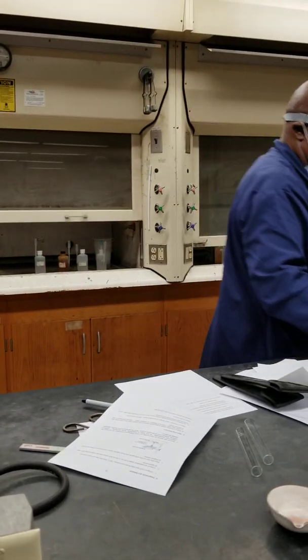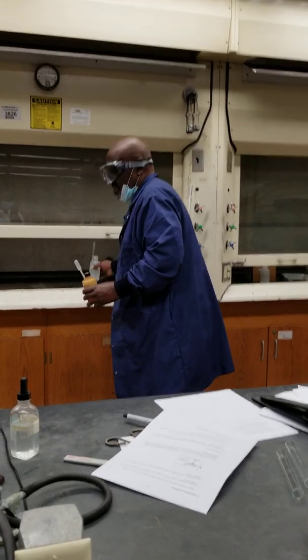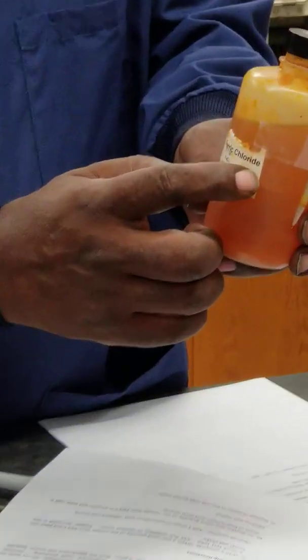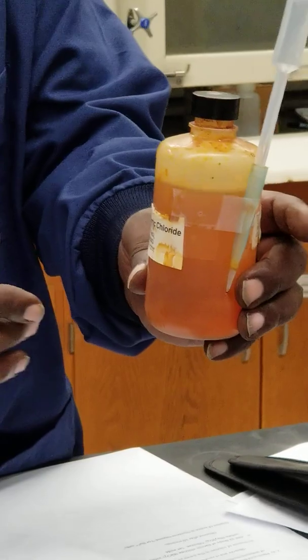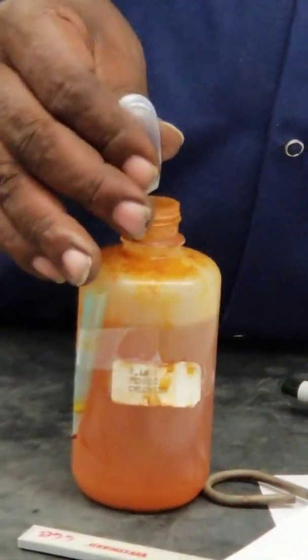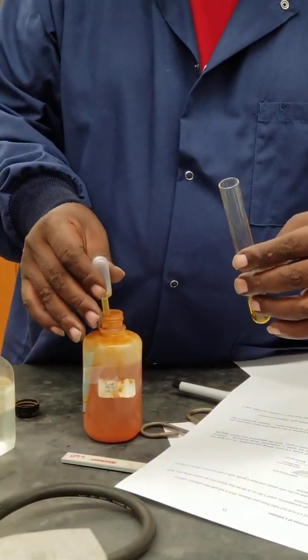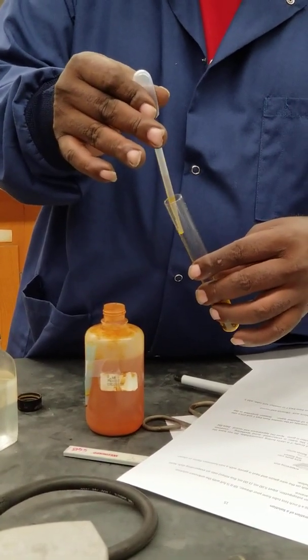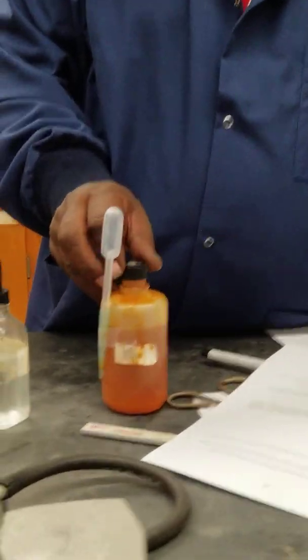Just two more simple reactions. The next one asks us to observe what happens when we take a ferric chloride solution, or iron-3 chloride solution. You can see what it looks like — it's been around for a few days. I'm going to use the plastic pipette, very useful for quick deliveries when precise volumes are not essential. So that's the iron-3 chloride solution.